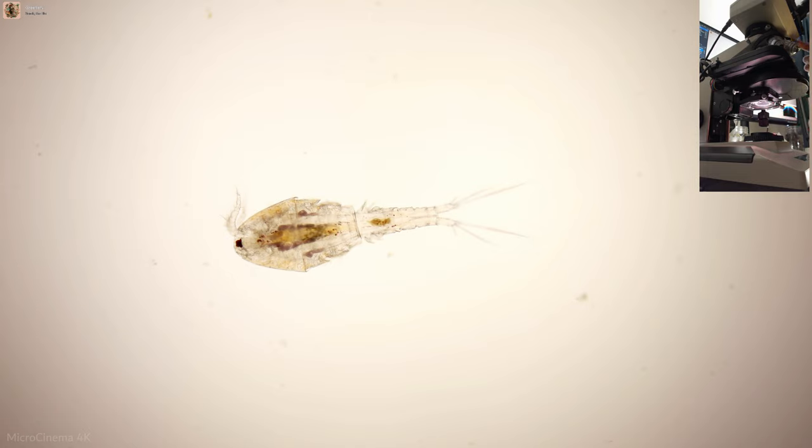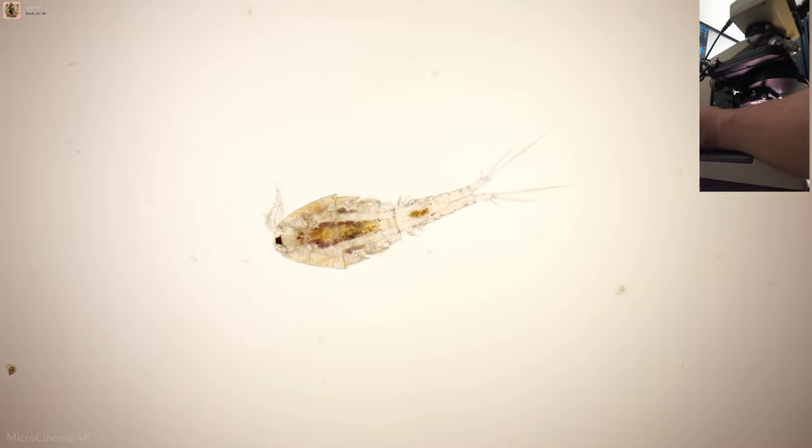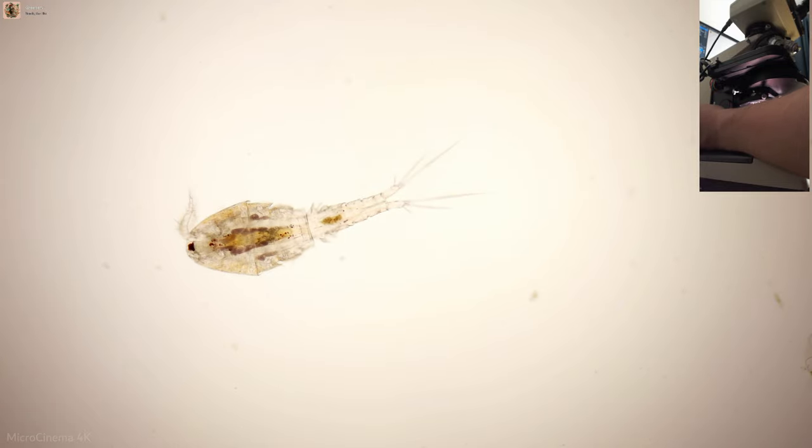Now since I don't have anything going on up top in the microscope, this really doesn't do anything except cut down the input light by half. And since I've got plenty of light and a plenty sensitive camera, it's not that big of a deal.